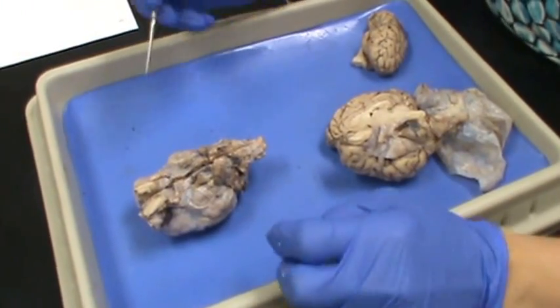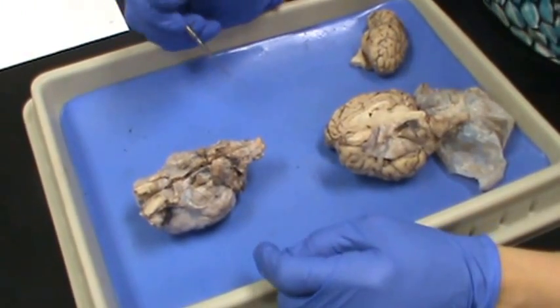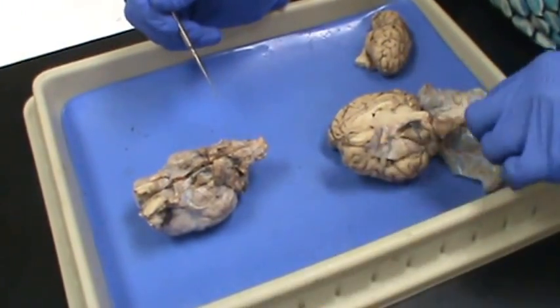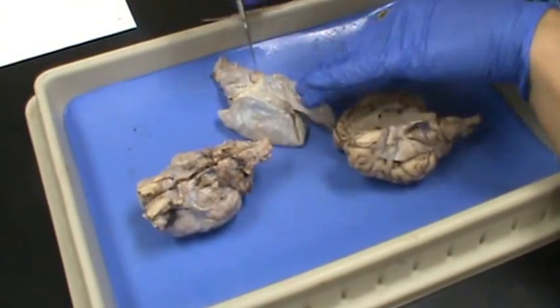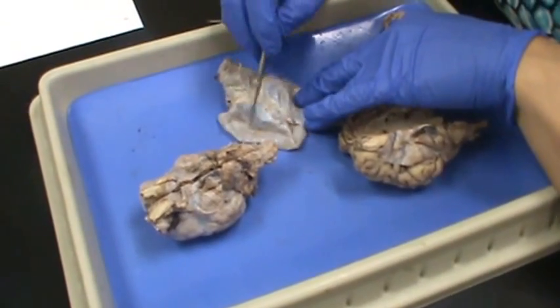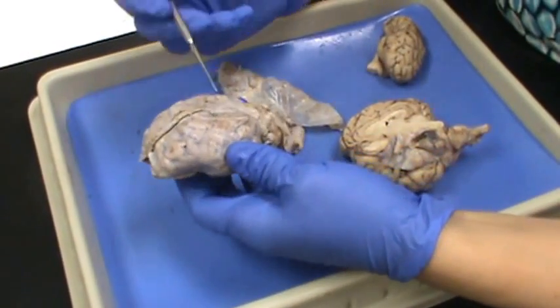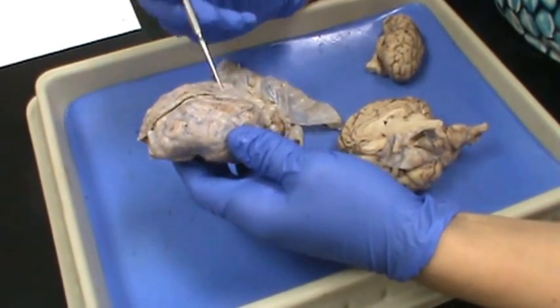This is the sheep brain. You have three meningeal layers covering the sheep brain. Here you have the dura mater, which is on the outside, and you can see it on the outside of the sheep brain.